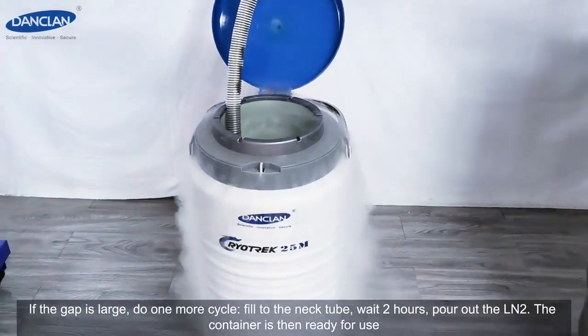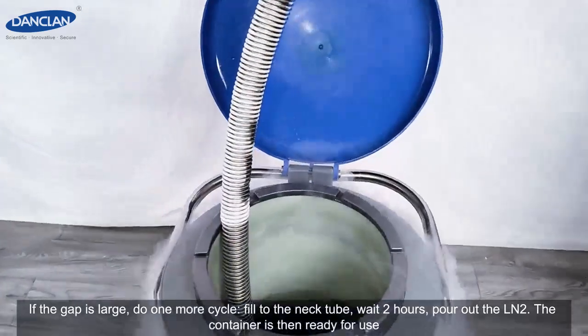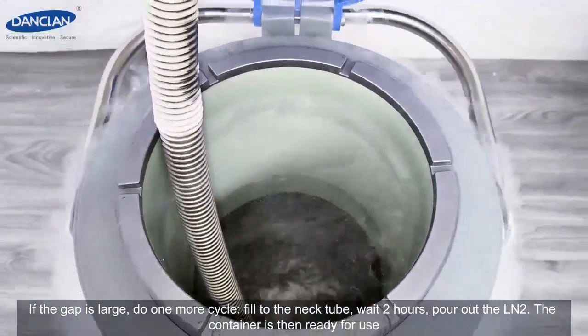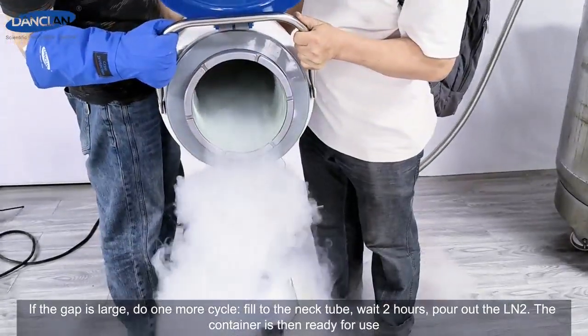If the gap is large, do one more cycle. Fill to the neck tube, wait 2 hours, pour out the LN2. The container is then ready for use.